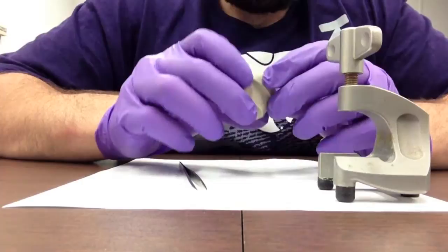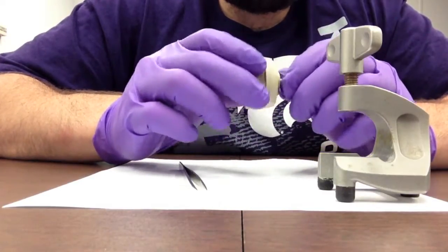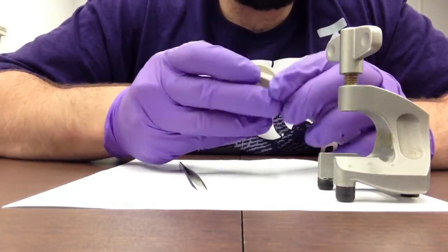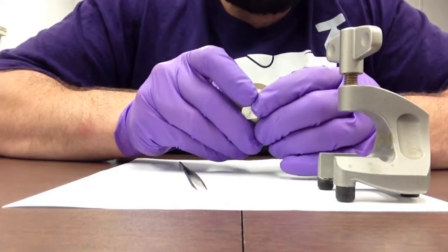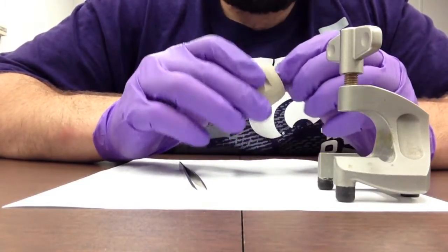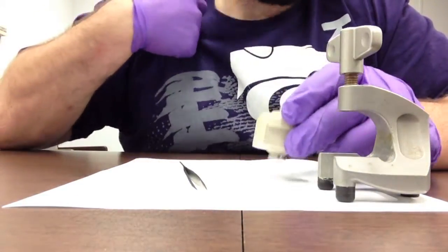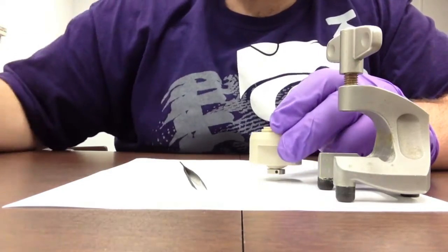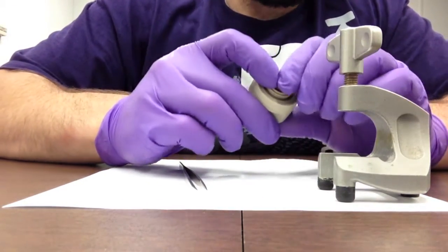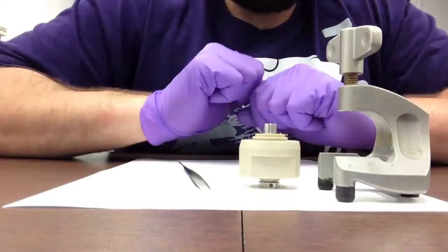Being that the sleeve is 18 millimeters in diameter, all my pieces are cut to 18 millimeters or slightly less. 11/16ths is the closest in American, and that actually provides me a little ease of assembly. So applying the piston in, I can assemble the cell to almost a full state.